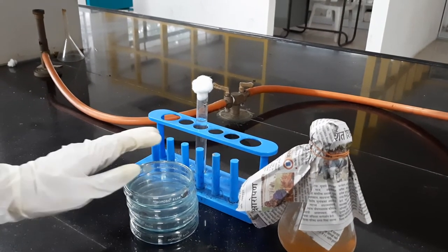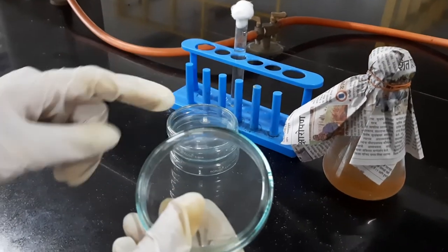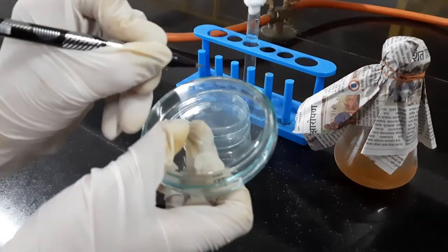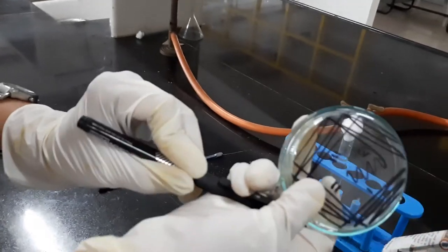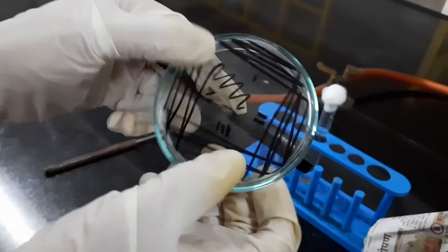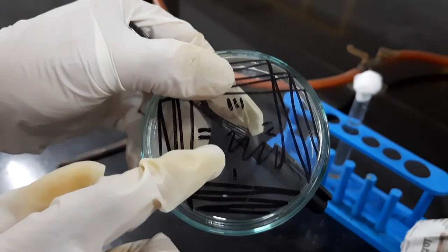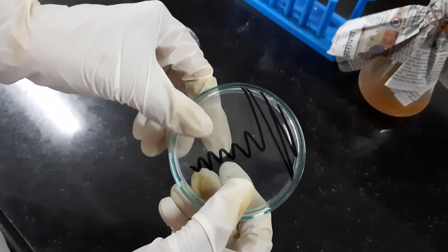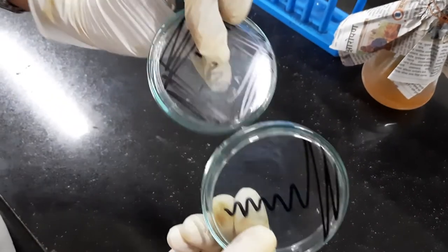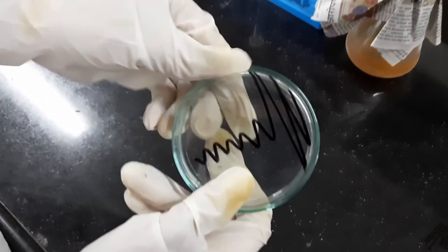After disinfection, I will prepare the plate. I have unwrapped the sterilized plate and now I will mark it with the streaks. Here you can see: this is the first quadrant, the second quadrant, the third quadrant, and the fourth quadrant, and then I have streaked it in a zigzag manner. The second plate has T-streaking. So my two plates are ready — first is the four-quadrant streak and the second is the T-streak.